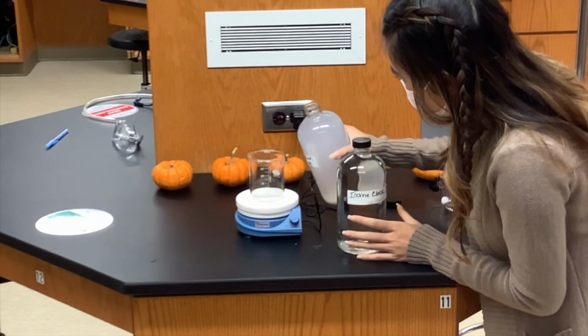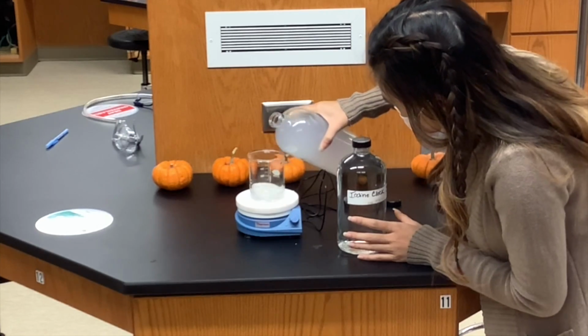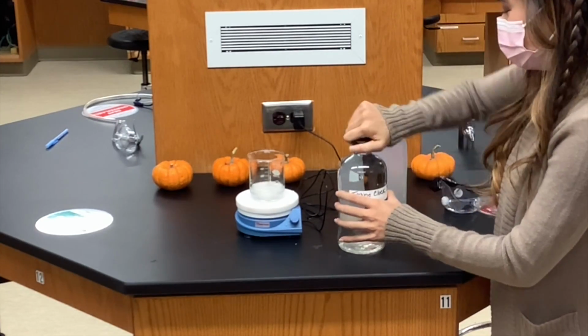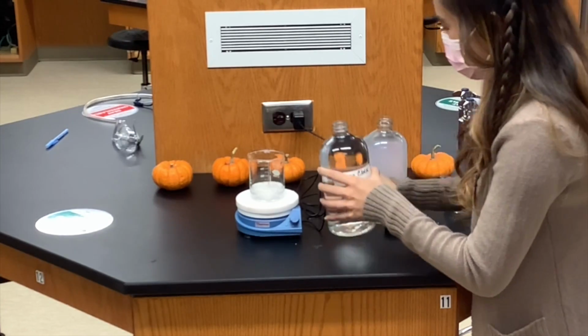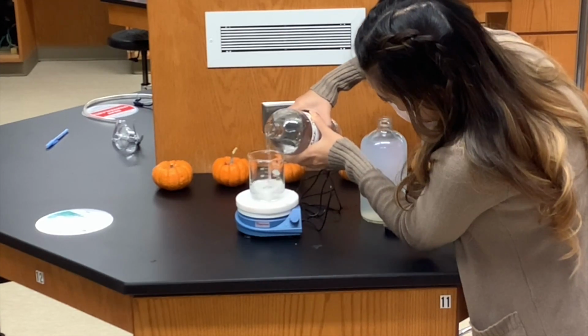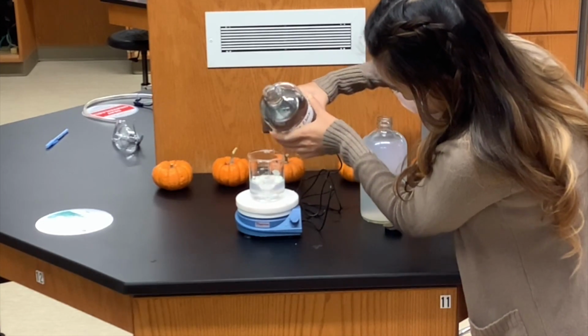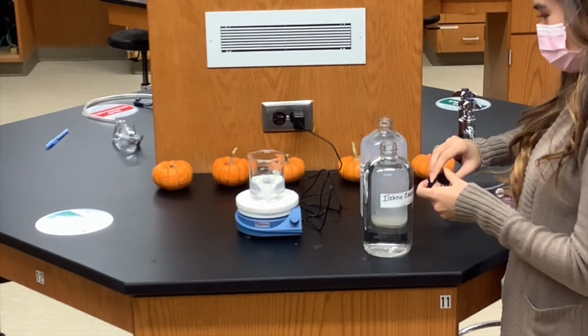In this reaction, we're mixing two colorless substances together, and they're going to perform a chemical equilibrium reaction. That means that the backward reaction is just as likely as the forward reaction. So this is called iodine clock. Once all of the initial reagent is consumed, we're going to see a color change when the iodine is produced. So we can count out and time this to a clock.